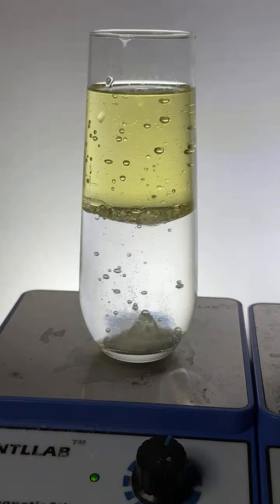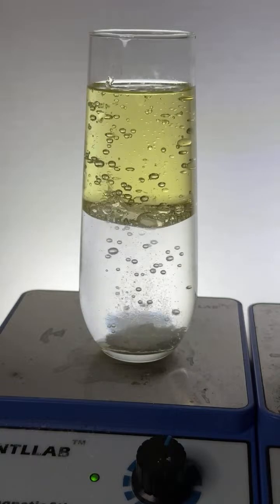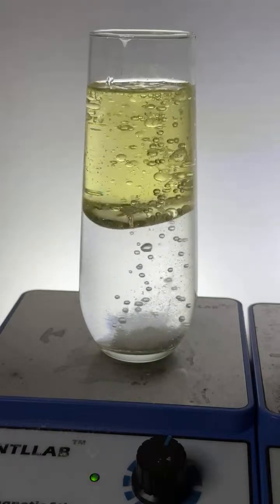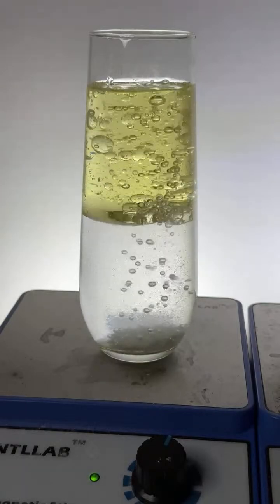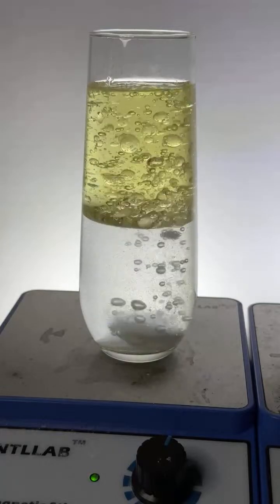Oh, yeah, that's pretty. That's cool because you can see it much better without the dyes. You got it, SC Zul. You got it, Fidro. Vinny, you got it. The whole thing. Could be contamination of the water, Katie, I agree. It's pretty, man. Look, it's just beautiful.